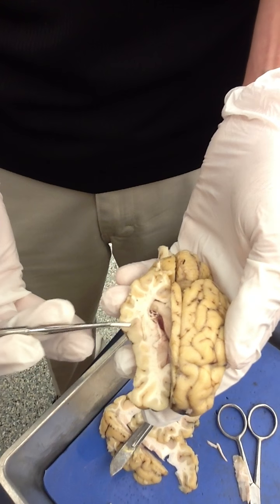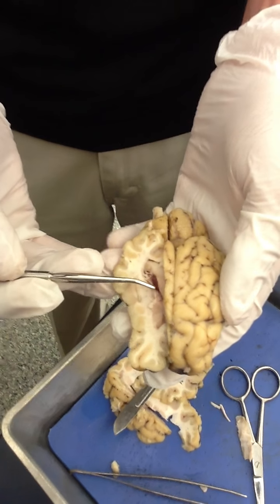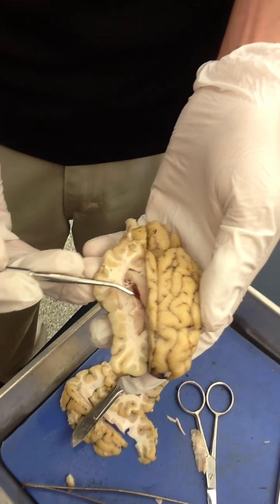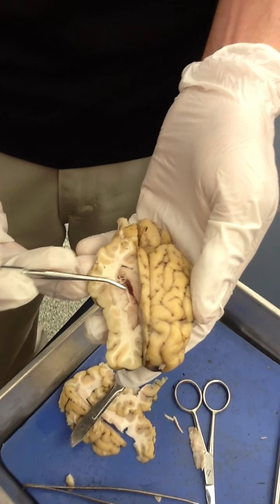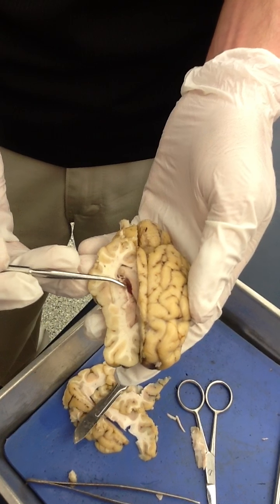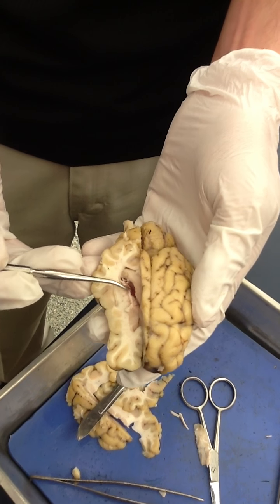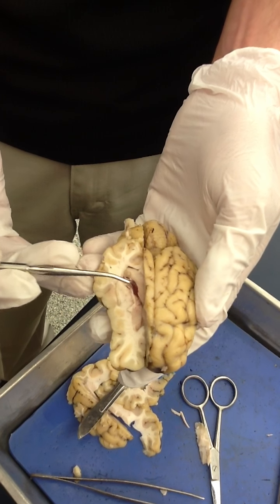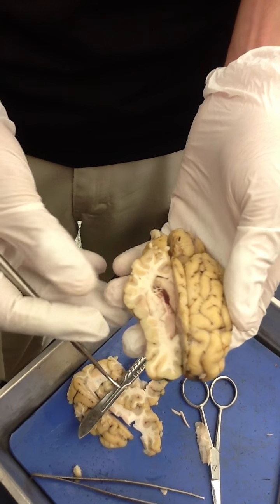In the ventricles — in all the ventricles, but particularly in the lateral — on the floor of the lateral ventricle, we see this kind of red seaweed-looking stuff. This is choroid plexus, and that's what makes all the cerebrospinal fluid. You have that present in the lateral, in the third ventricle, and in the fourth ventricle as well.